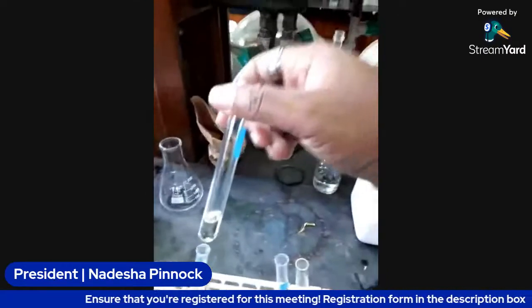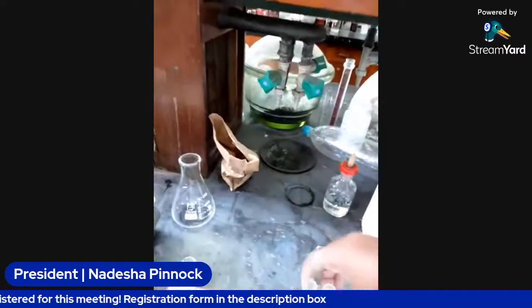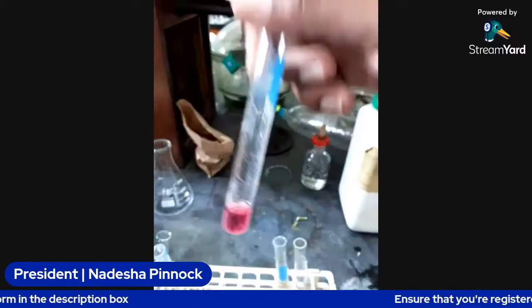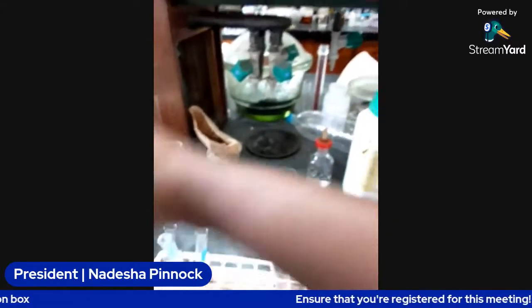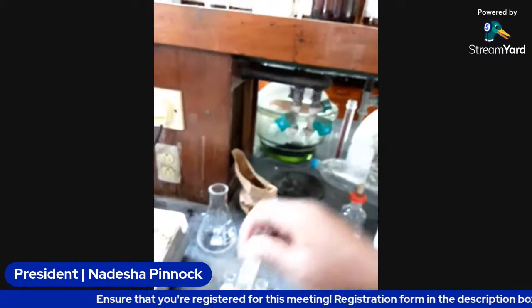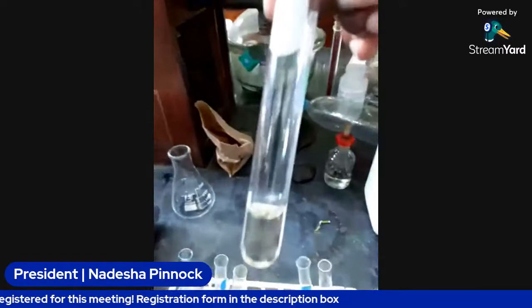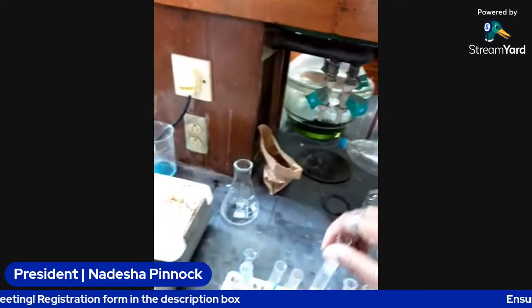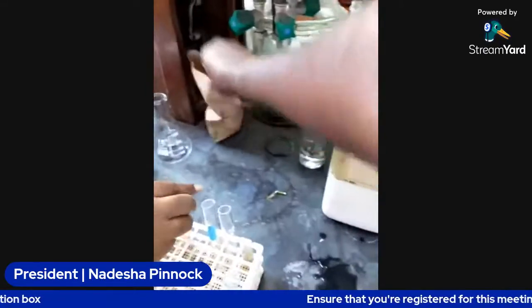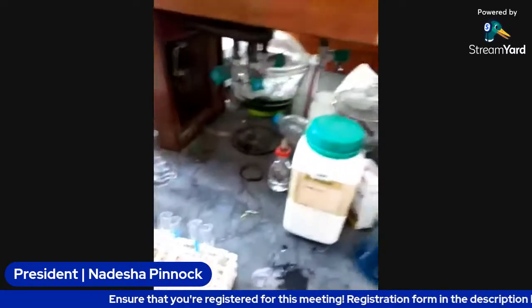So far we have oil, we have cheese, and we have syrup. This is some syrup. This is some fruit punch juice. This one is oil as well. Oh, this is sugar. So we have left to prep the milk, glucose, and egg. Yeah, so we have the egg left.